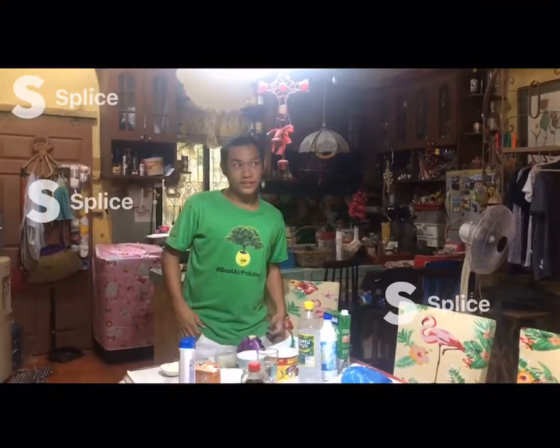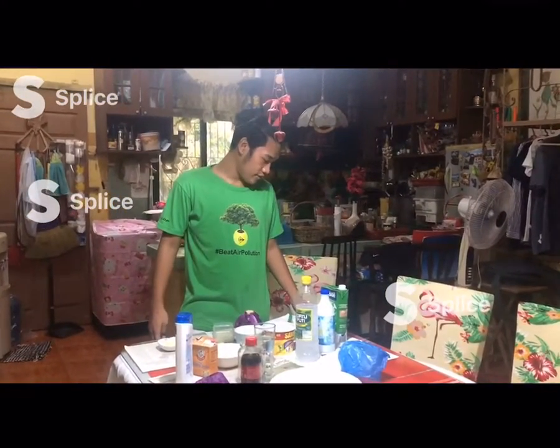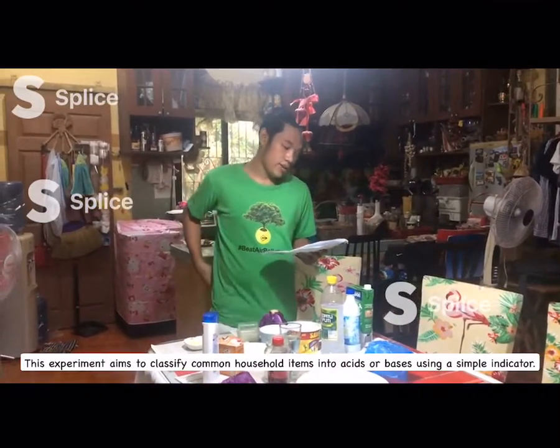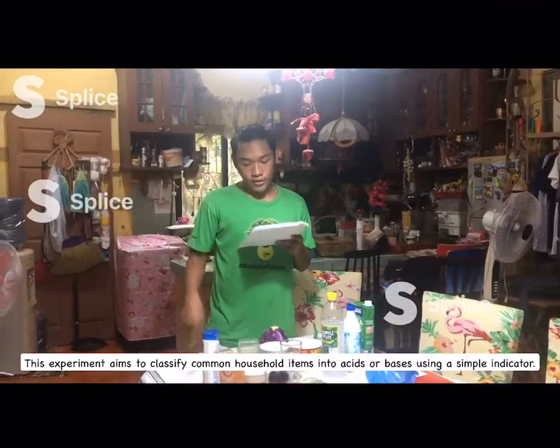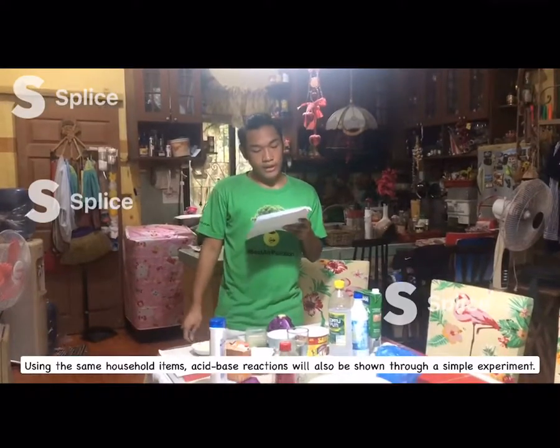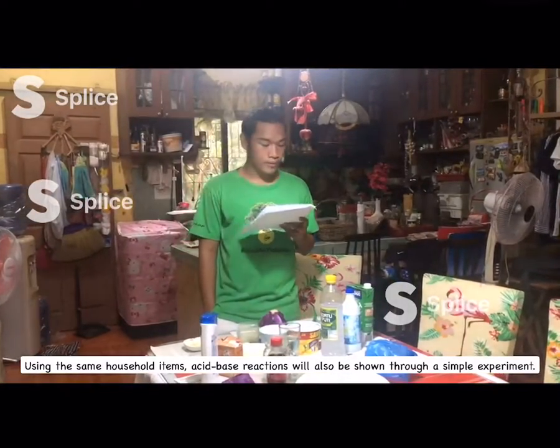Good afternoon, guys. And this is laboratory exercise number 3. This experiment aims to classify common household items into acids or bases using a simple indicator. Using the same household items, acid-base reactions will also be shown through a simple experiment.